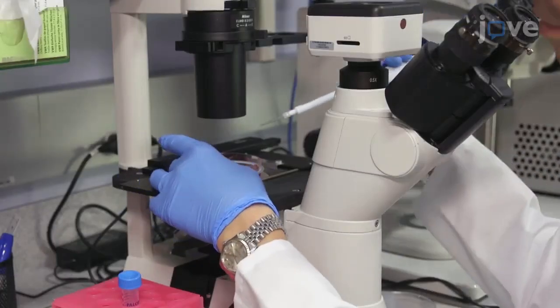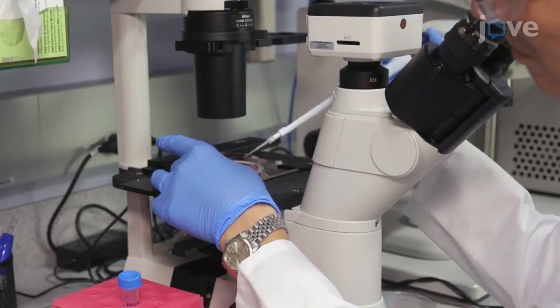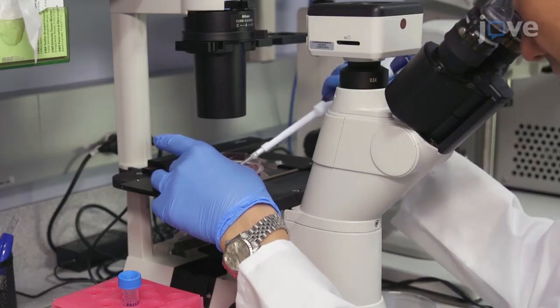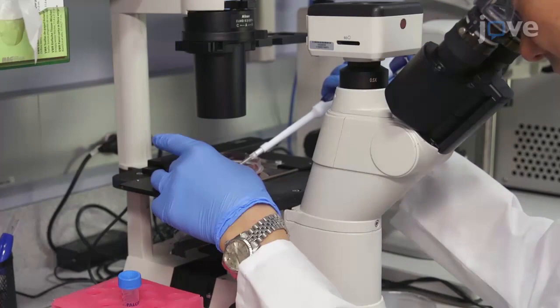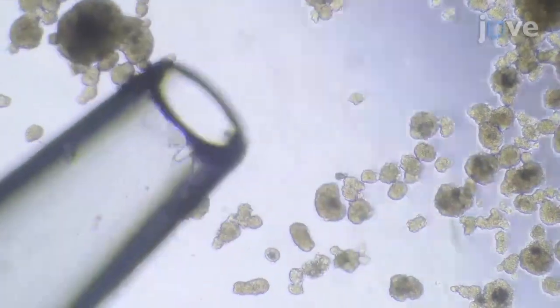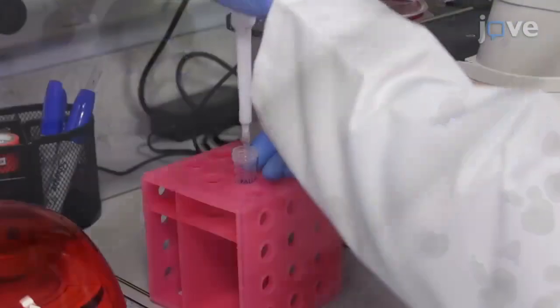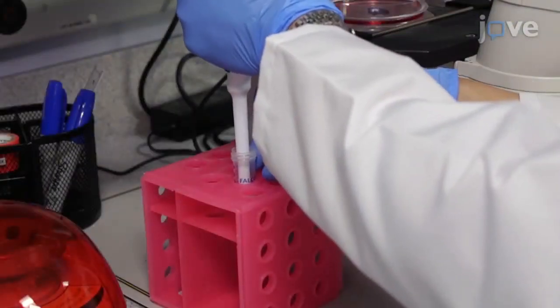After obtaining human islets and incubating overnight, count and handpick 200 to 300 islets using a P200 pipette. Transfer the islets to a 15 mL conical tube containing 5 mL of complete islet media, pre-warmed to 37 degrees Celsius.